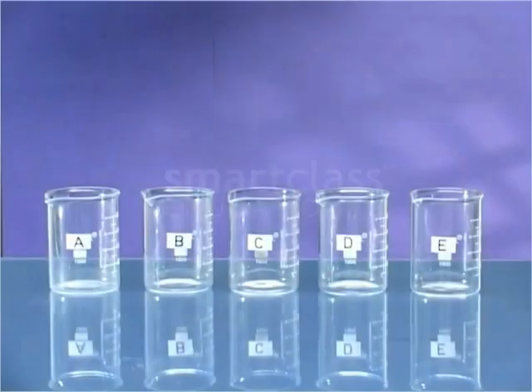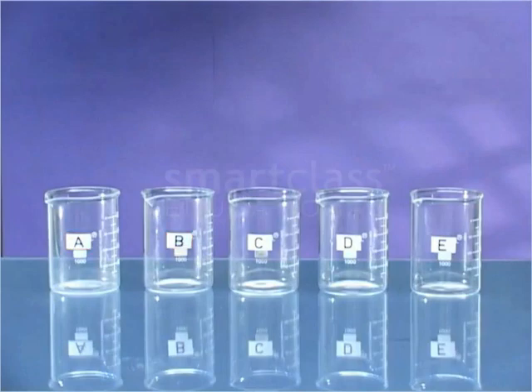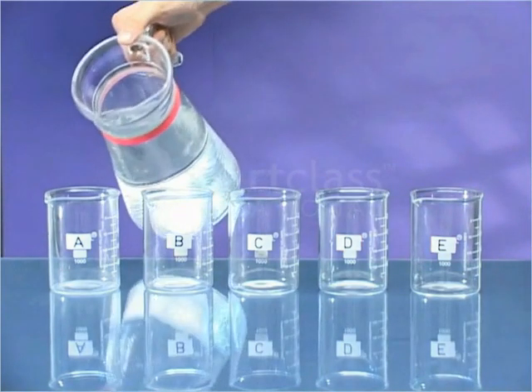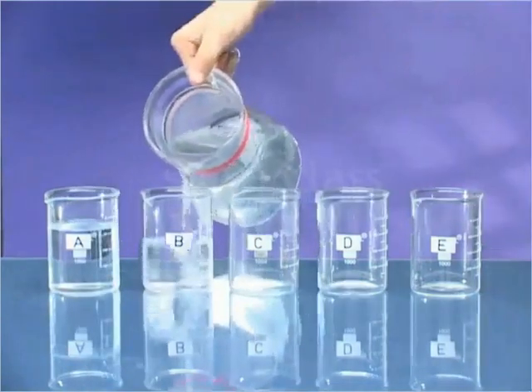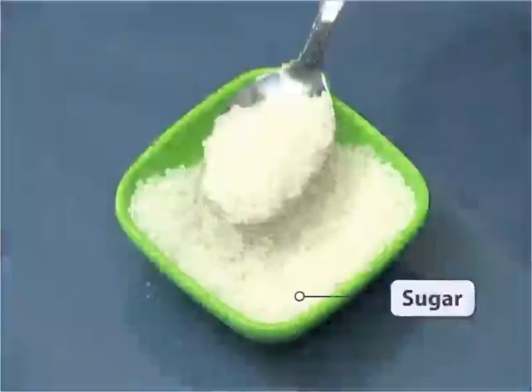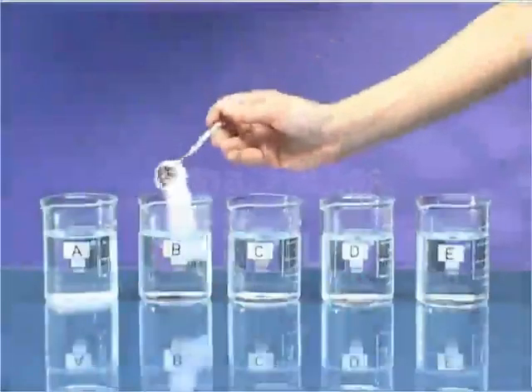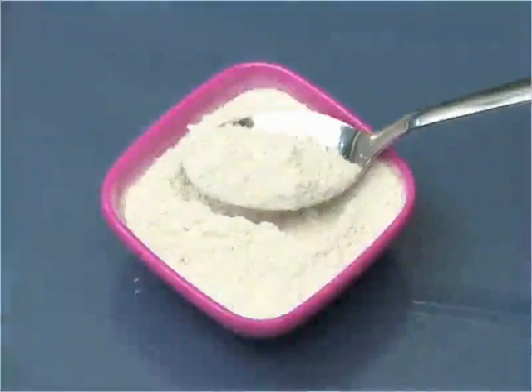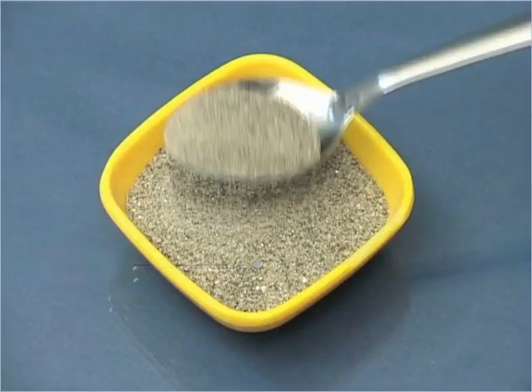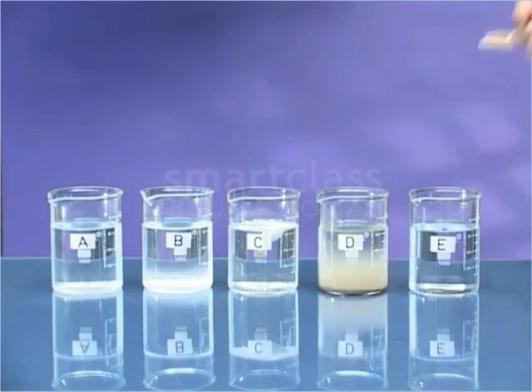Take 5 beakers and label them as A, B, C, D, and E. Fill each beaker about two-thirds with water. Add a spoonful of sugar to beaker A and salt to beaker B. Similarly, add small amounts of chalk powder, sand, and sawdust into the other beakers C, D, and E respectively.